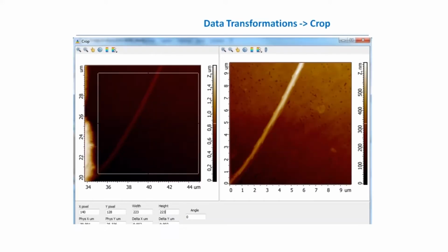So sometimes when we need to correct not the whole image but some of its fragments, we should use methods which apply to some areas of the scan. I call this set of methods Aftertouch. The first method, the simplest one, is named crop.